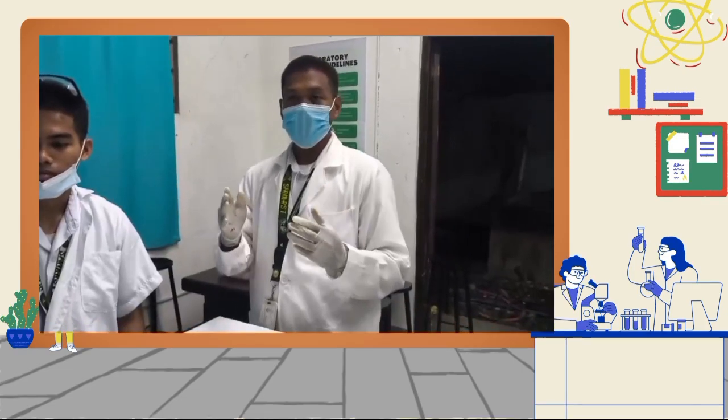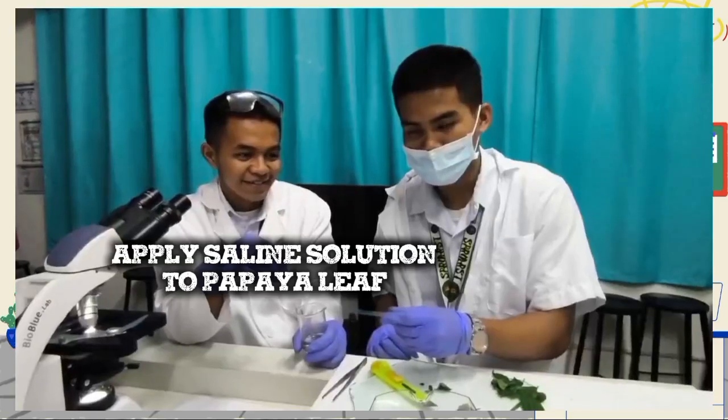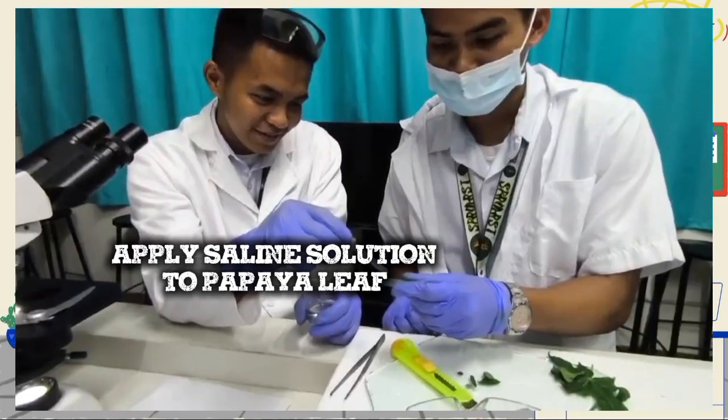Proceeding to the microscopic test. Applying the saline chemical on the papaya leaf.